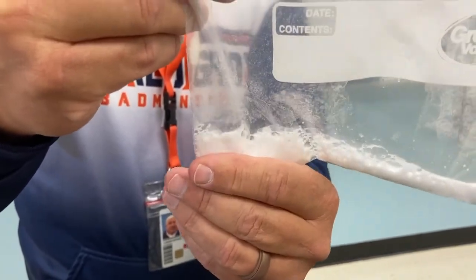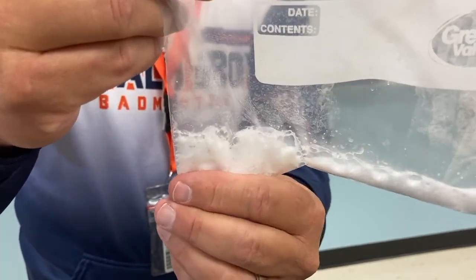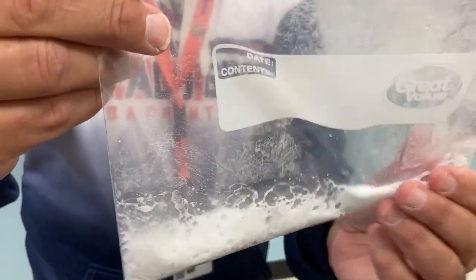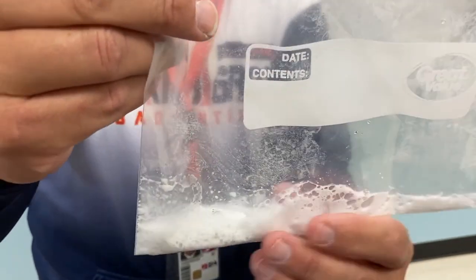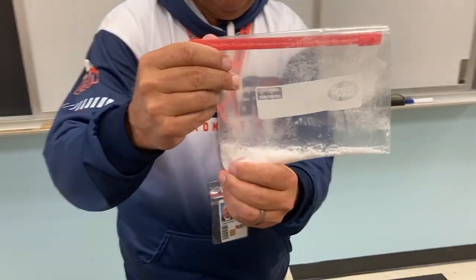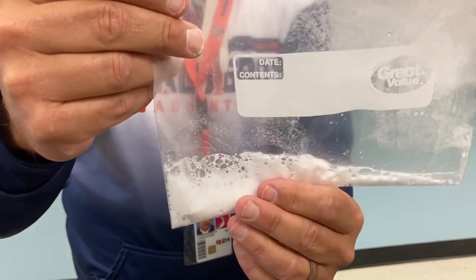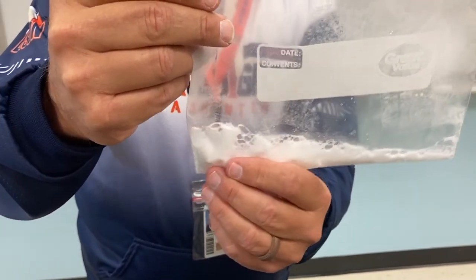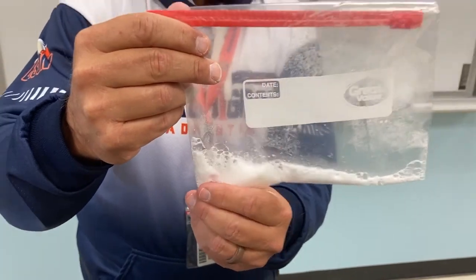Do you feel a hot temperature at parts or a cold temperature? Do you feel both temperature changes? Yes. This side over here is kind of cold, and this side is getting warmer. Oh. So we see both a temperature increase, a temperature decrease, and we got bubbles. There's one thing we're not seeing, though. You guys can probably think at home what that is. Well, color-wise, everything still looks pretty white.